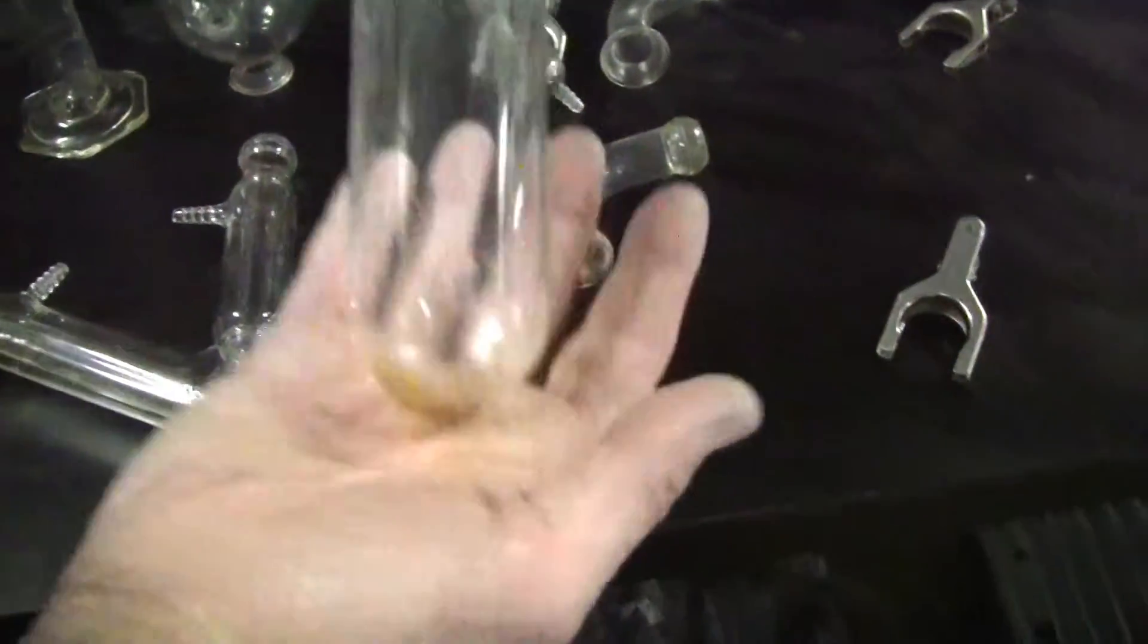Why do I do that? There we go. Just the bottom. It's cleaning up, but there's no problem with it.